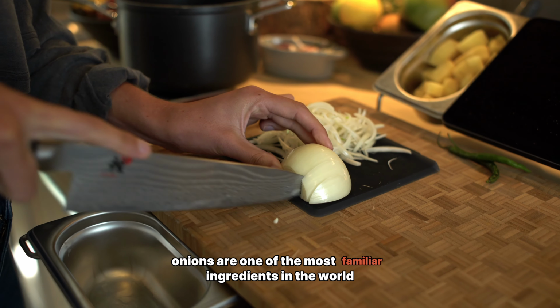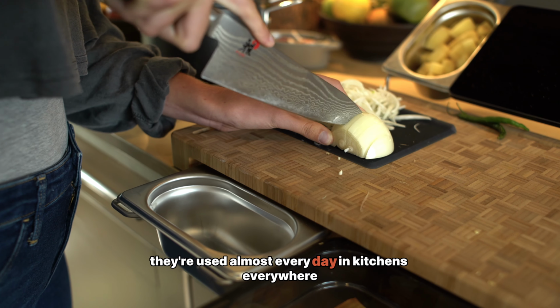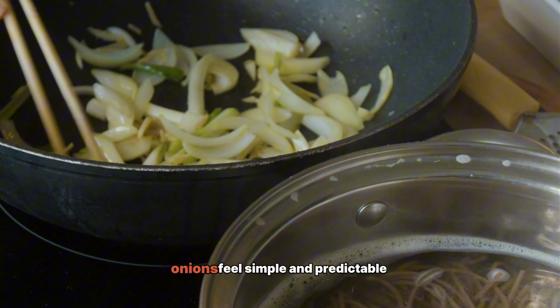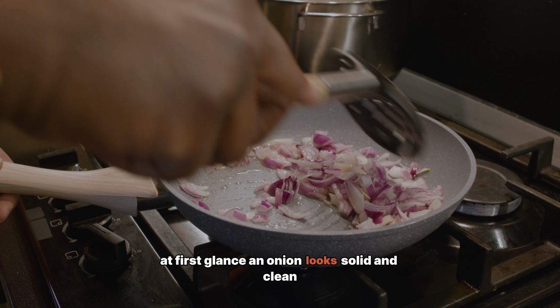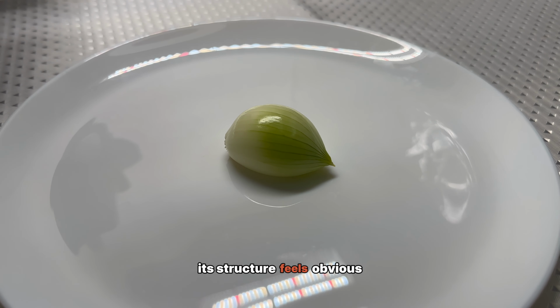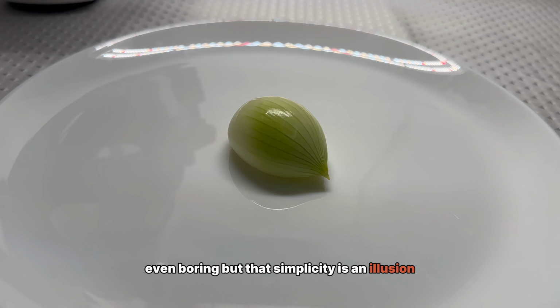Onions are one of the most familiar ingredients in the world. They're used almost every day in kitchens everywhere. Raw or cooked, sharp or sweet, onions feel simple and predictable. At first glance, an onion looks solid and clean, layer after layer neatly stacked. Its structure feels obvious, even boring, but that simplicity is an illusion.